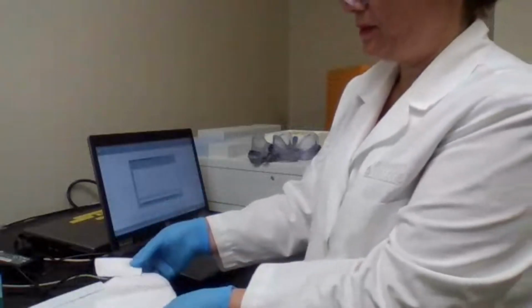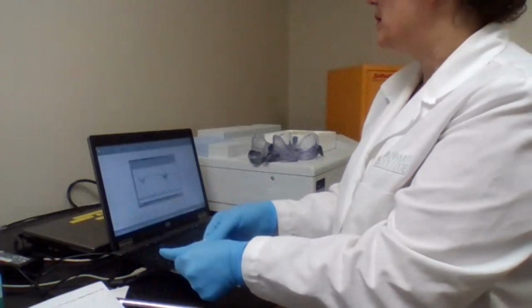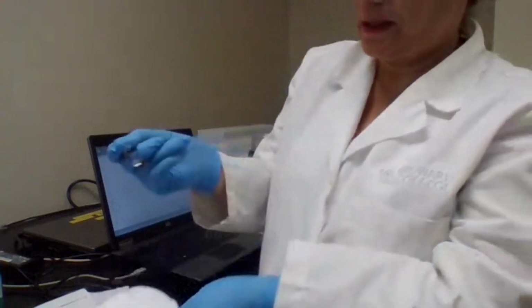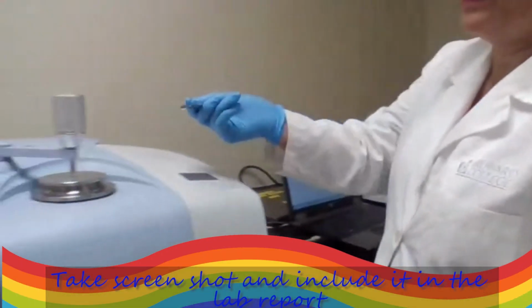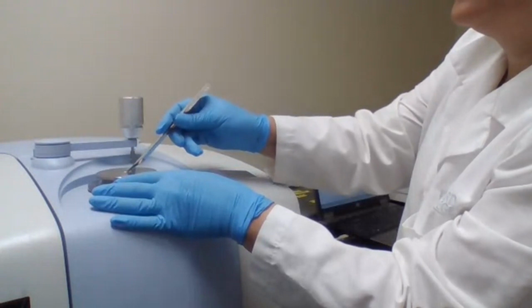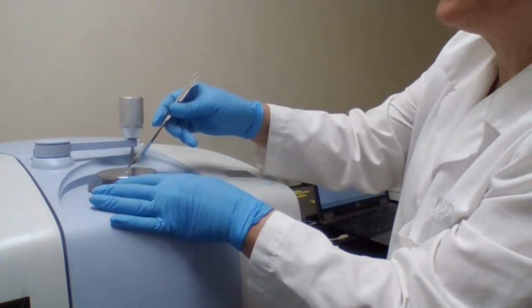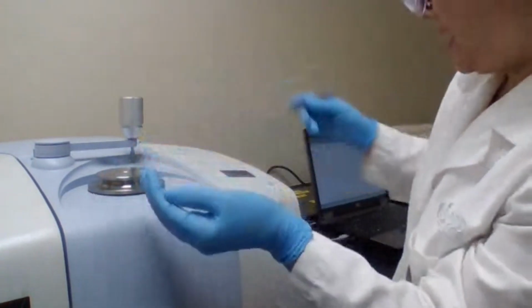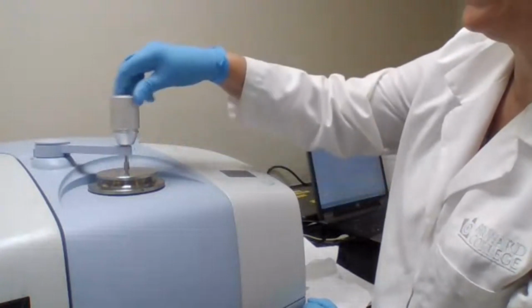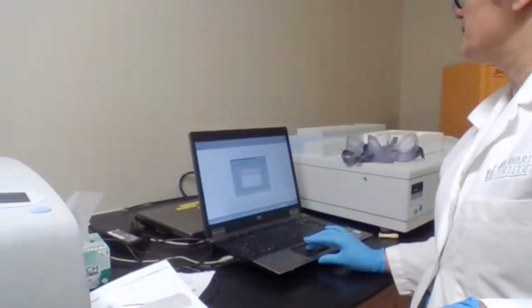Let me get my sample ready. I'm using a very small sample of the product, very tiny, and placing it in the sample holder. The spectroscopy techniques are non-invasive. That means the sample that you are using is minimal, and after determining the IR for your sample, you can actually recover the sample. You can take it out and do melting point. It's asking for the name of the sample, so I'm giving a name for the sample.